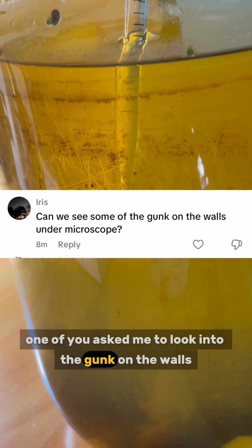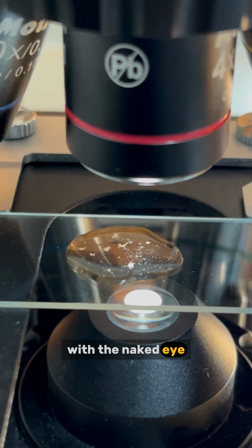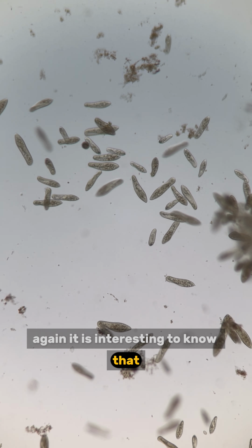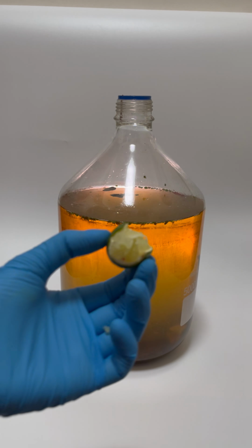One of you asked me to look into the gunk on the walls. Let's check it. Interestingly, you can even barely see some things moving with the naked eye. It means they are so large and so many. Those moving things are paramecia again. It is interesting to know that even though they are single-celled microorganisms, they can still be observed with the naked eye.